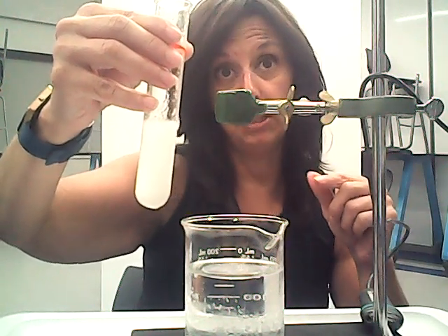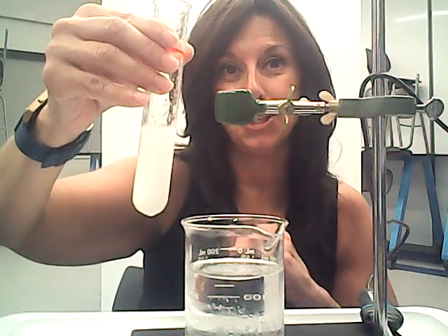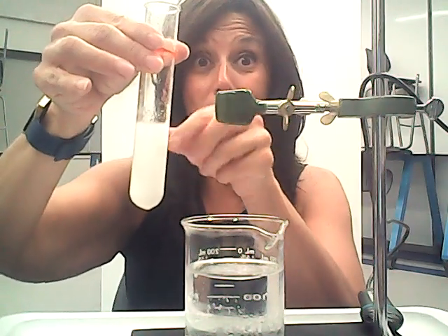I am sharing this data with your teacher. So you'll get this data chart from your teacher. So that's it, freezing lauric acid.